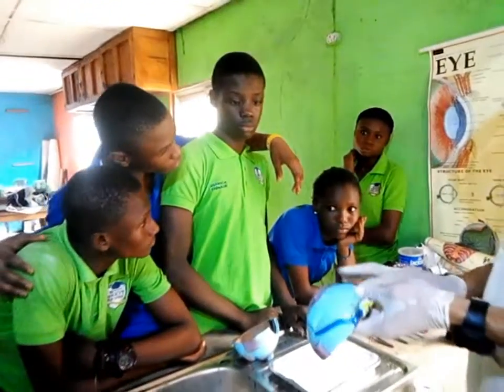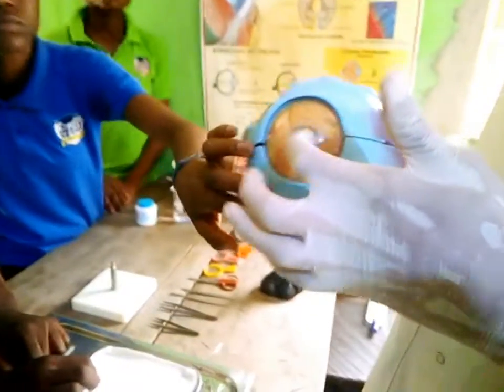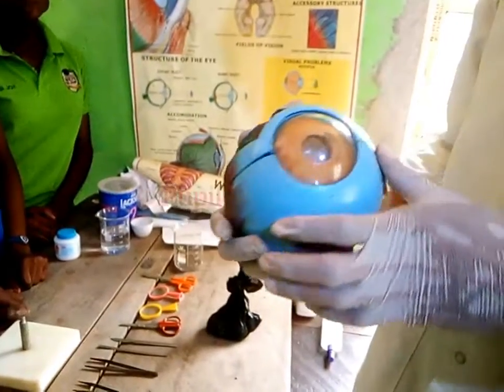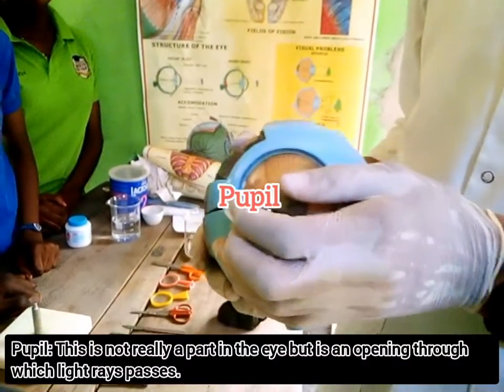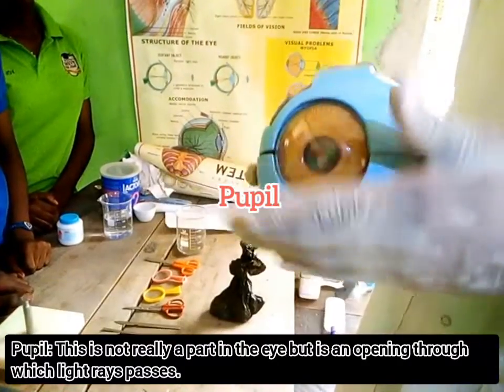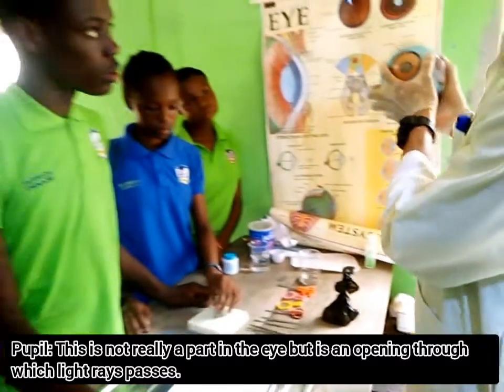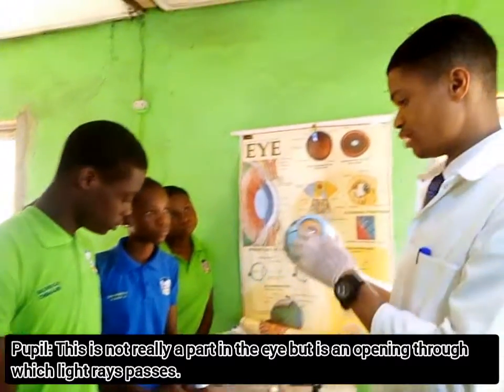This is the muscle here. Now this opening is what we call the pupil. Now the pupil is not really a part of the eye. It's an opening. Do you get that? Through which light waves pass. Are you getting me? So you can see that inside of the eye is very dark, just like your own eye. Are you getting me? Very dark.